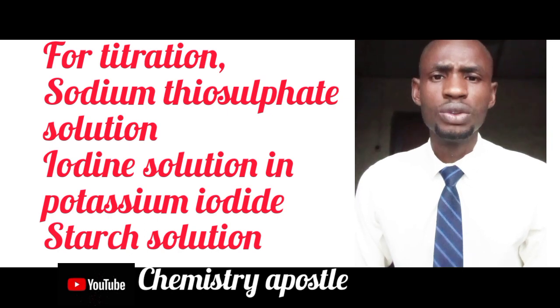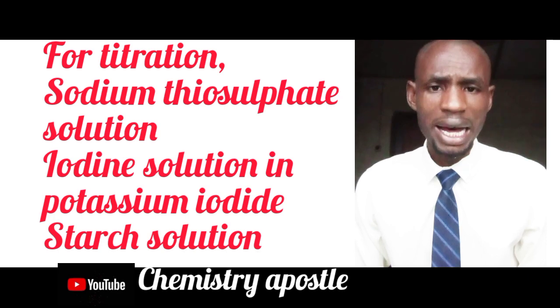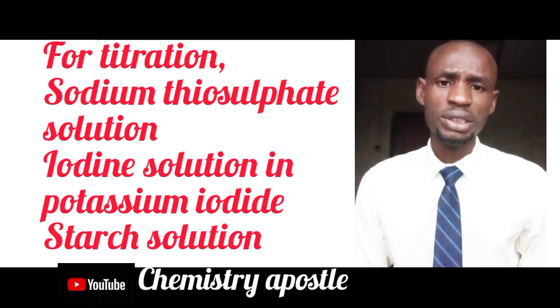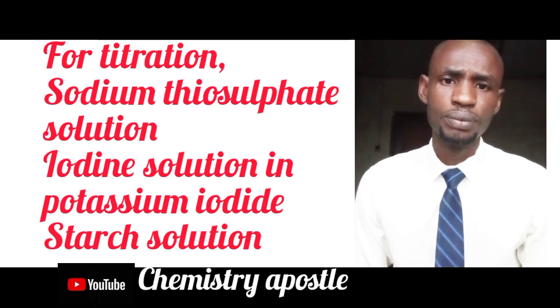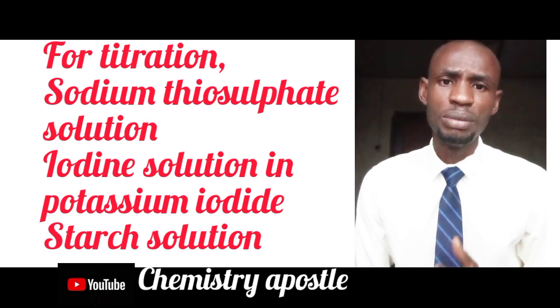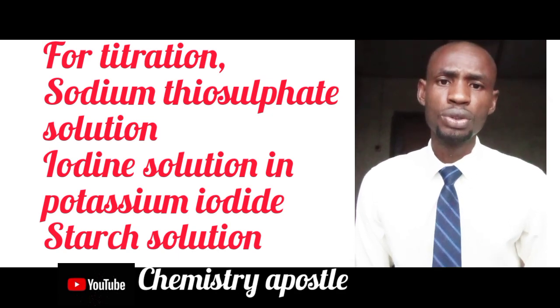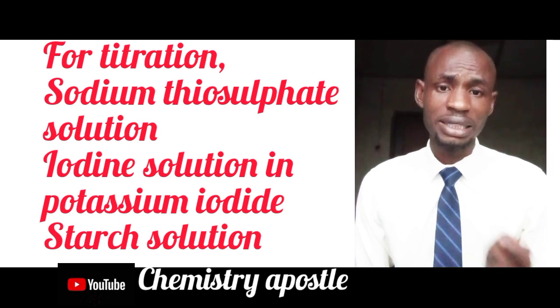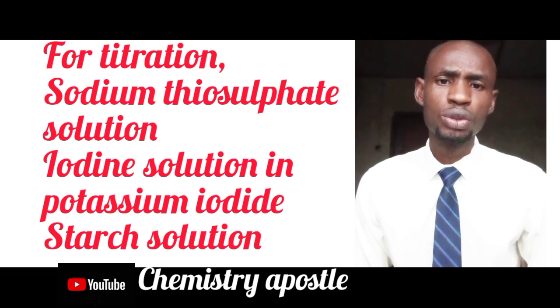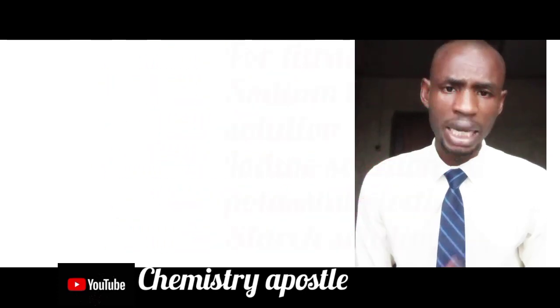Note that you are not adding starch at the beginning of the titration. You will add the starch after you have titrated for a little while and the color in the solution fades to yellow — that is when you add the starch. Immediately you add the starch, the color changes to blue-black, which shows the presence of starch and iodine. At the end point, the solution changes to colorless, indicating you have completed the redox titration.